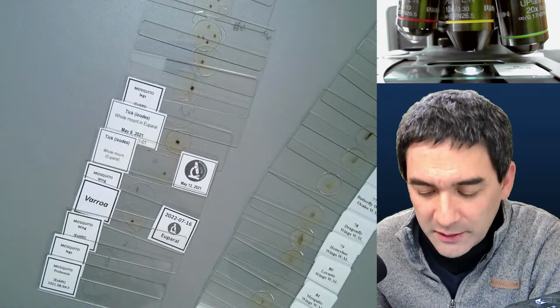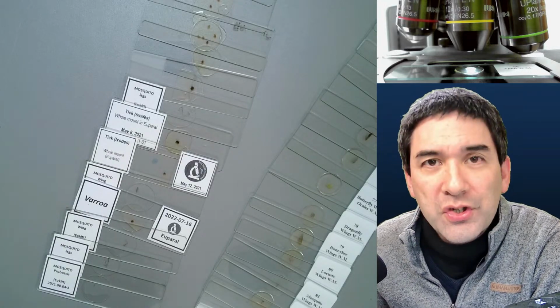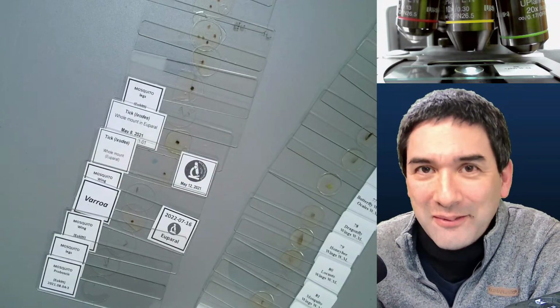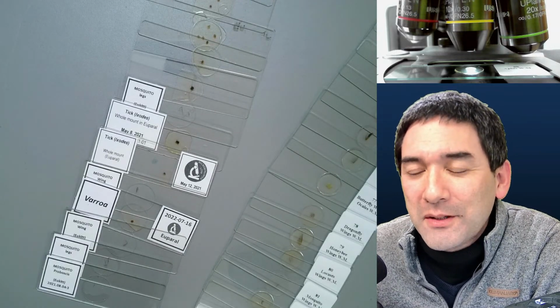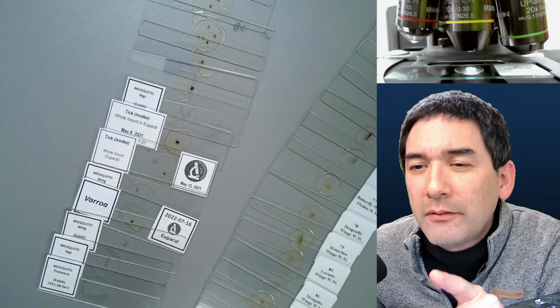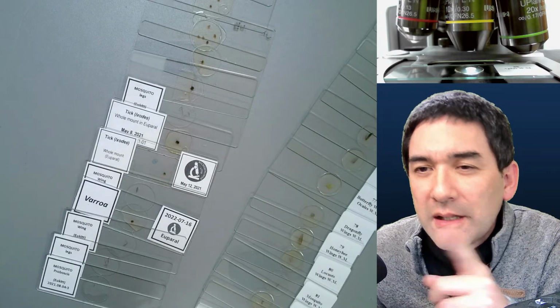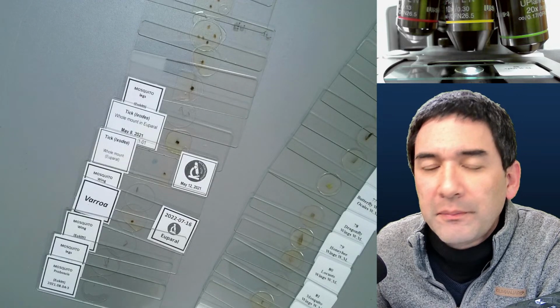We're just going to look at those specimens here. There might be, of course, questions that I'm not able to answer. I'm also always having a look over here into the chat. There might be a small delay here.